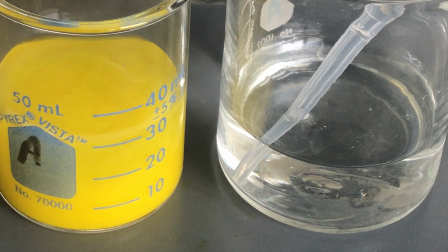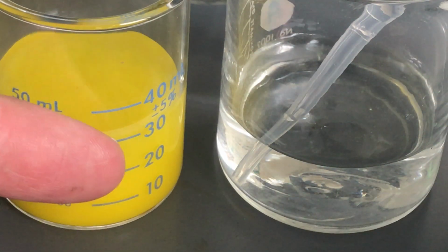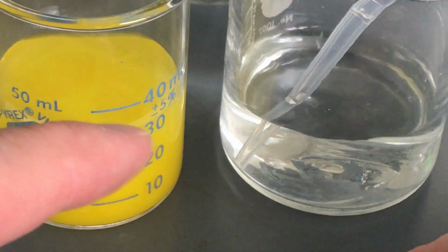And again, this has been a double replacement reaction that shows how I can have two soluble materials, but when you mix two soluble materials together, the things that were in both of those might not be soluble together. So in this case, it was the lead from the lead nitrate over in this container, and it was the iodine from the potassium iodide in this container, and those two went together. So it was a positive from this one and a negative from this one.